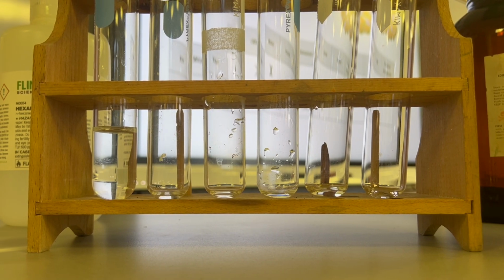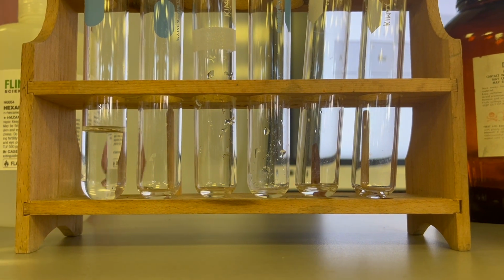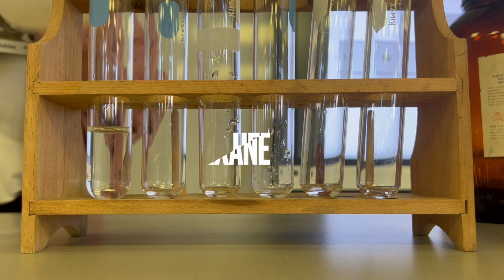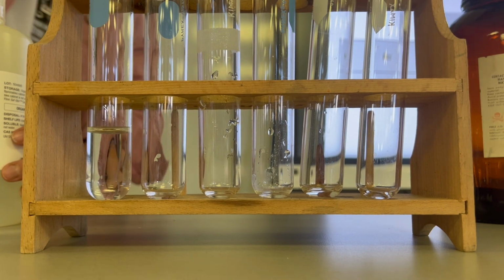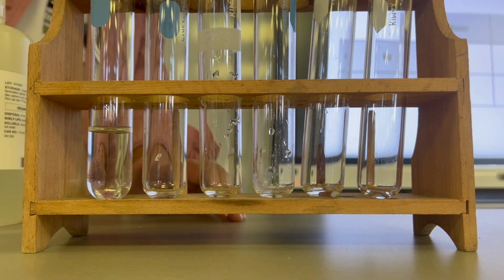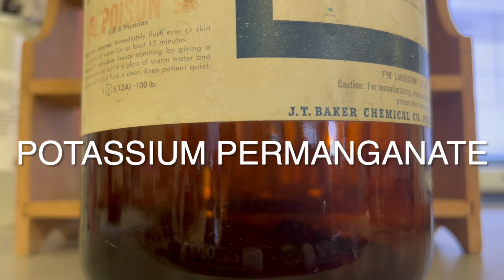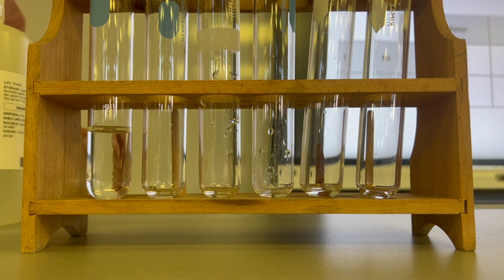Okay, we have got 4 different substances. We've got water. I don't have it labeled, but it's right there. I've got hexane. It's right there. This is iodine. Iodine is actually a solid. And this is a gigantic bottle of potassium permanganate. Okay, so those are my 4 substances, and I'm going to see how they interact with each other.